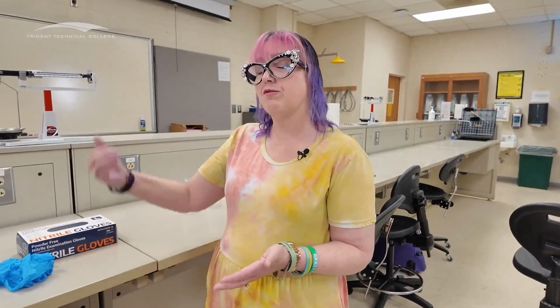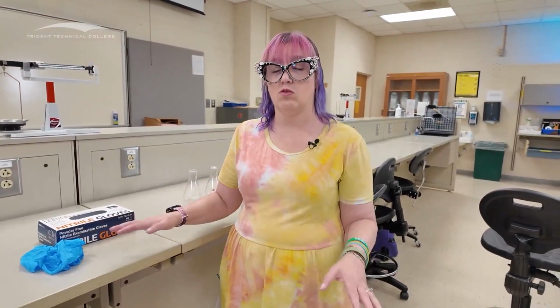I'm then going to wash my hands to make sure that I get anything off of my hands that shouldn't be there, because sometimes we accidentally get chemicals inside, okay? And then I'm going to go do whatever I need to do. When I come back to the lab, I'm going to go to the front bench. I'm going to wash my hands again, just because I'm paranoid. And then I'm going to put on another pair of gloves. And I'll do that before I handle anything in the normal part of the lab. Okay, because chemicals can be just about anywhere. So we want to make sure that we're dealing with clean hands before we put them back into those gloves.